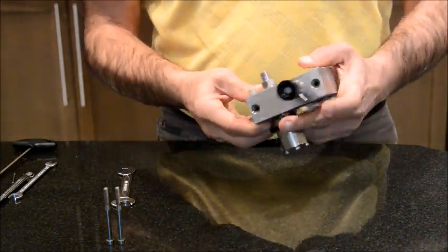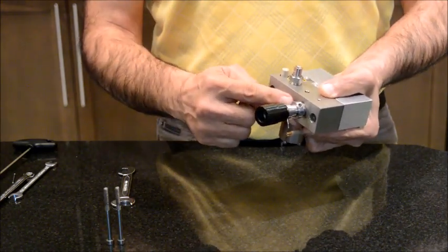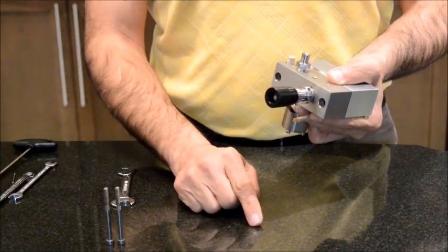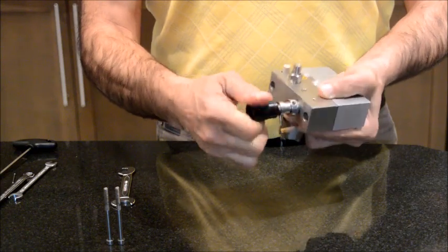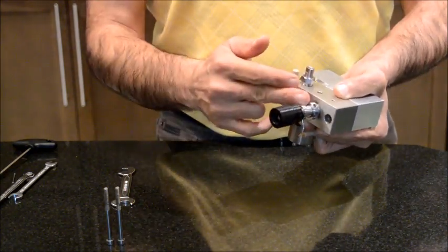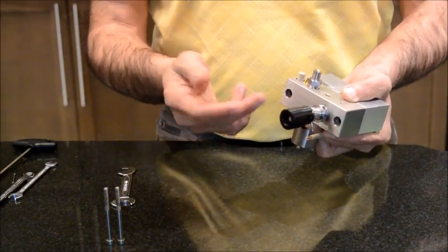The other part that I want to talk about is this purge valve. The purge valve is where the pump pushes the mobile phase out of the pump into your column. And then you have this valve that you can use to break the flow, and instead of going to your column, it goes to the waste. Let's say if you want to flush the system.